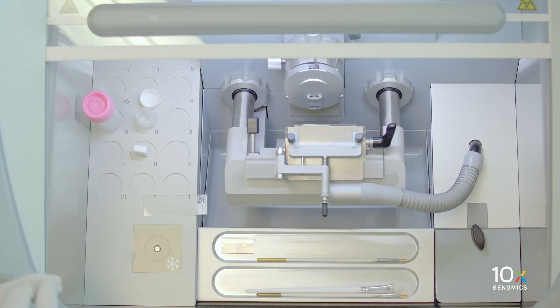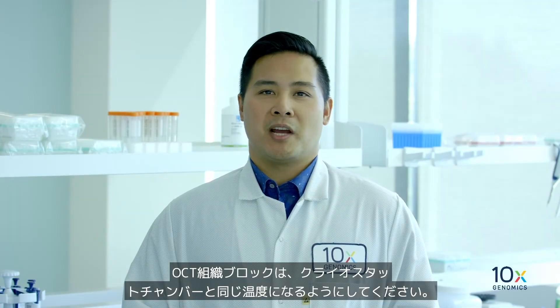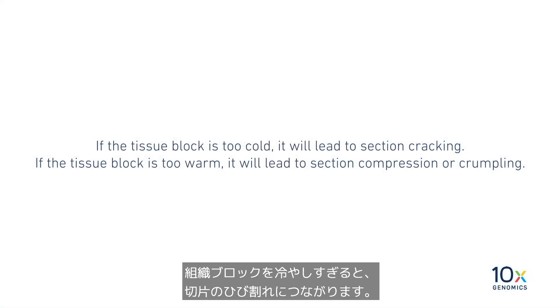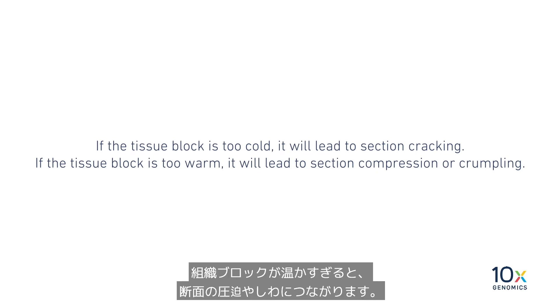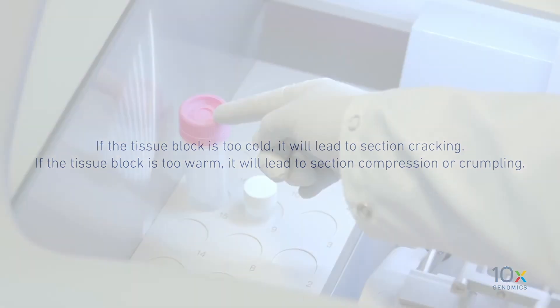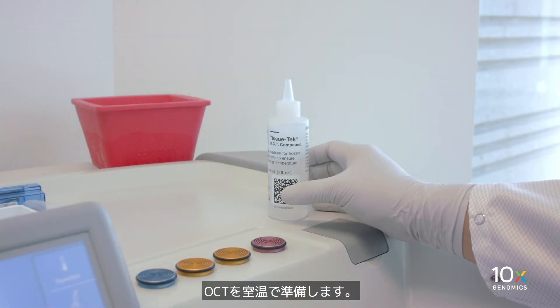We also have the OCT embedded tissue block, which has been equilibrated to the cryostat chamber temperature for at least 30 minutes. The OCT embedded tissue block should be the same temperature as the cryostat chamber. If the tissue block is too cold, it will lead to section cracking. If the tissue block is too warm, it will lead to section compression or crumpling.